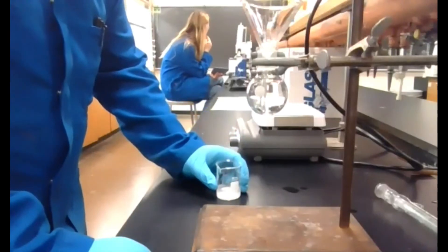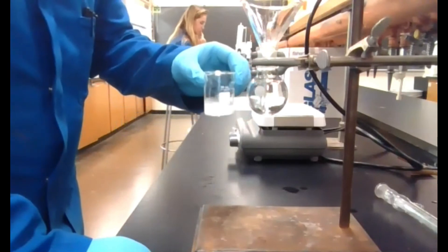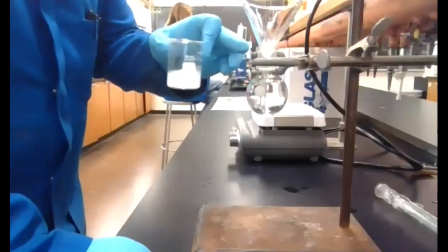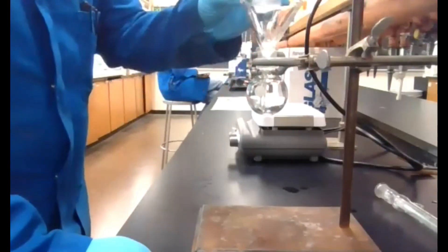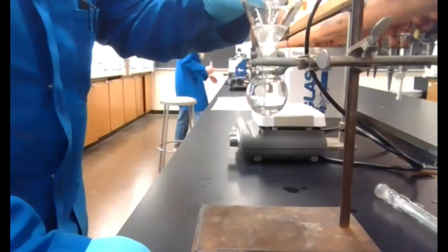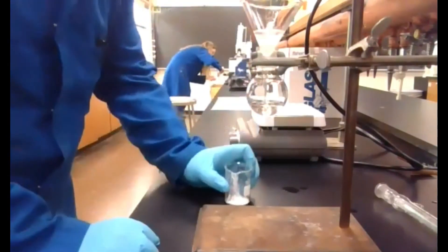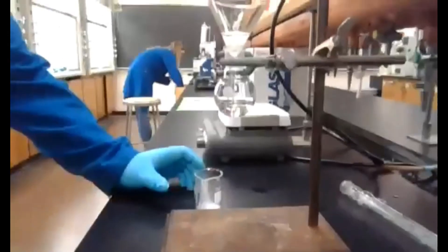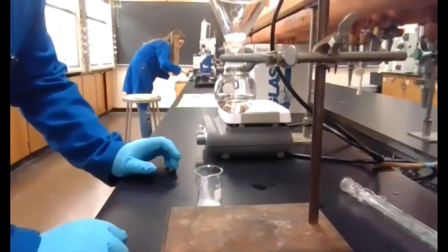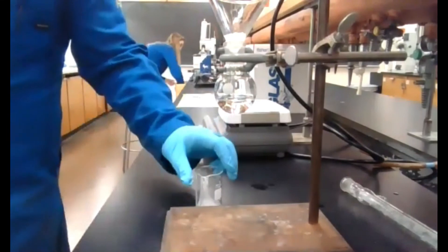So I have my organic layer that I've now dried with magnesium sulfate and let sit here for a couple minutes. I'm going to go ahead and filter it. So I just have my funnel with a little plug of cotton in there and we'll go ahead and filter that through. This round bottom has been pre-weighed as well. We'll make sure to post all those weights up on Canvas. I'm going to go ahead and get the rotavap set up and we'll dry this down and get a yield. Awesome, thank you so much Daniel.